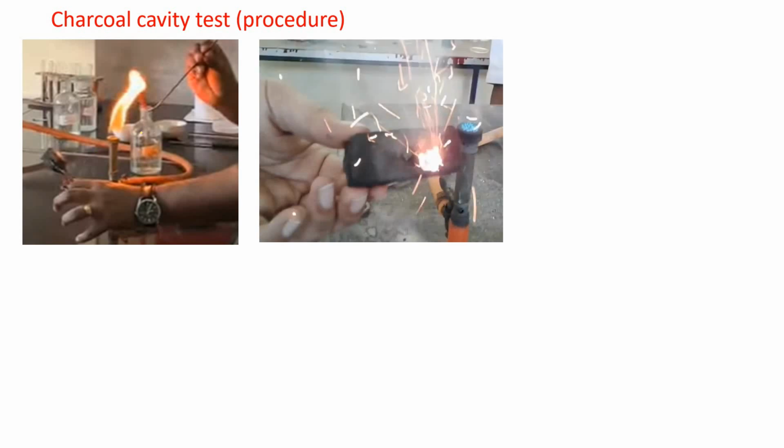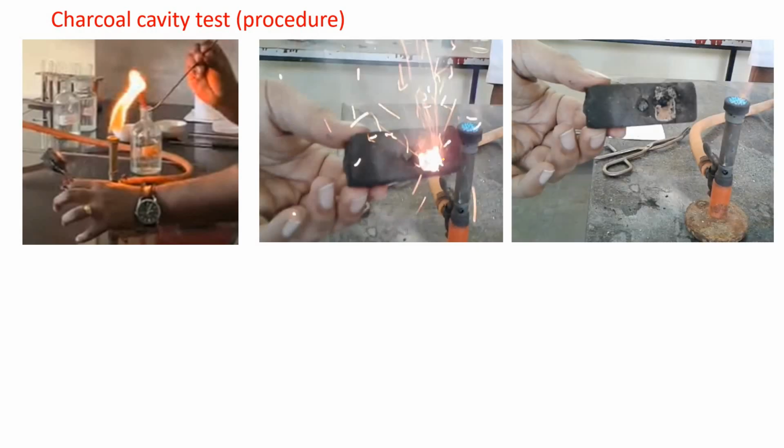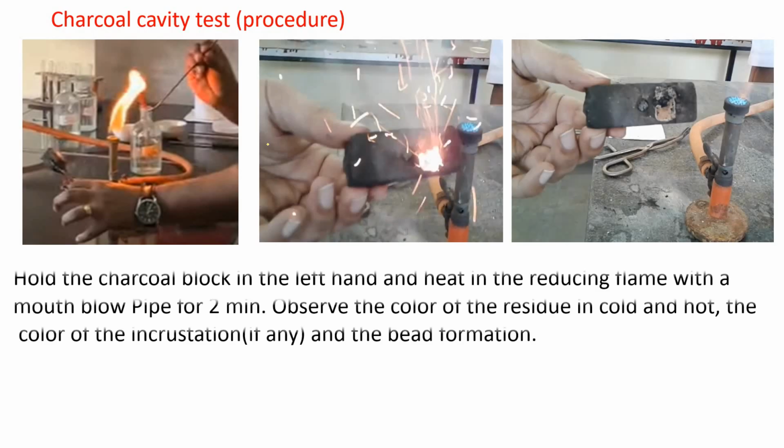Then it will be heated. Now we observe it in the hot condition as well as in the cold condition. What is the color of the residue? So hold the charcoal block in the left hand and heat with the reducing flame with the mouth blowpipe for 2 minutes. Observe the color of the residue in the cold and hot, the color of the incrustation, residue or incrustation if any, and the bead formation.